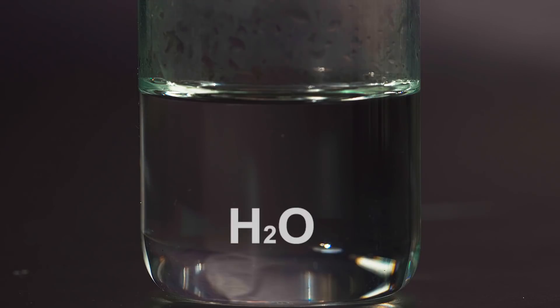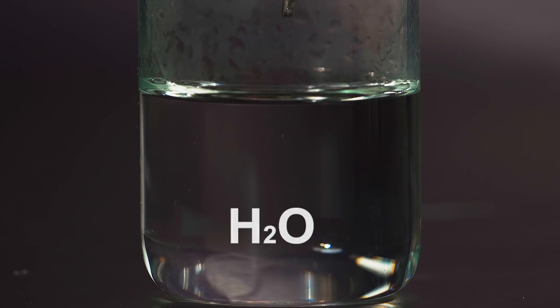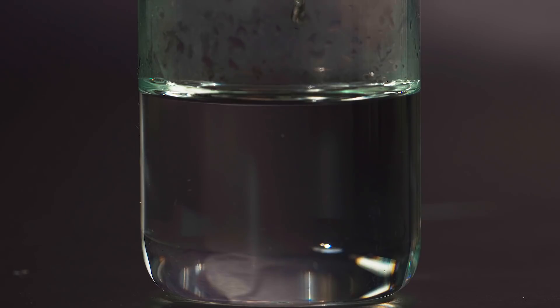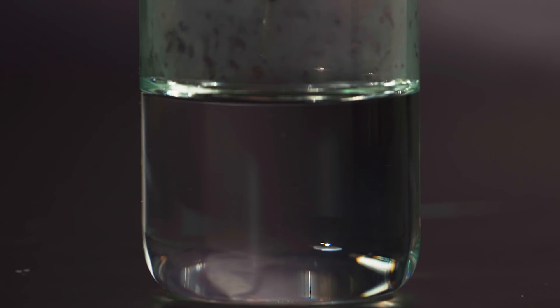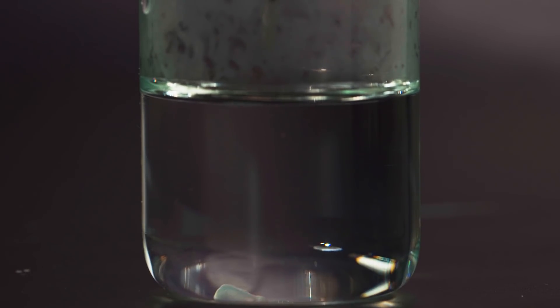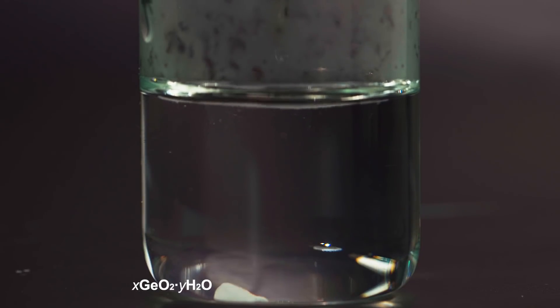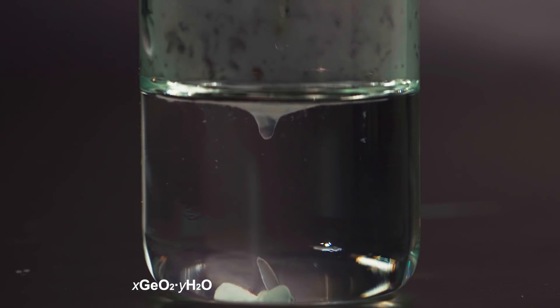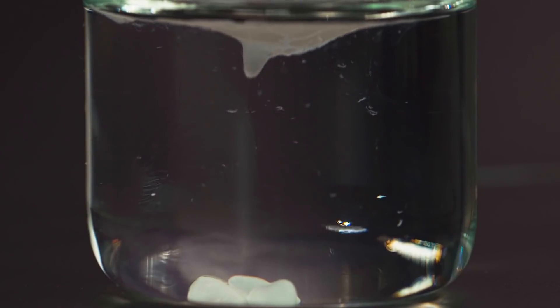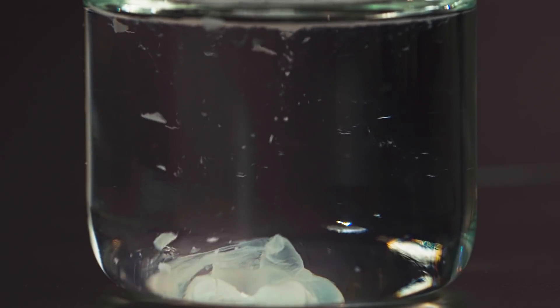Adding germanium tetrachloride to water causes its hydrolysis with the formation of germanium dioxide. To be more precise, it's not an oxide that's forming but a hydrated oxide, and it gets calcinated in order to get pure germanium dioxide.